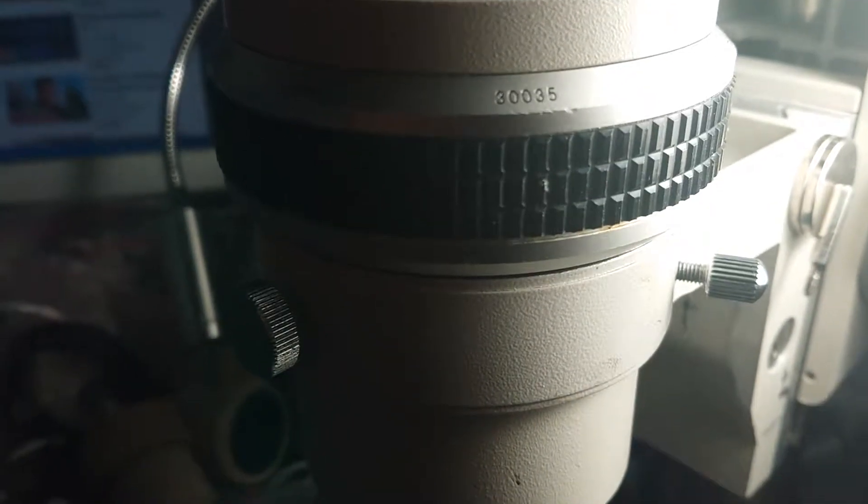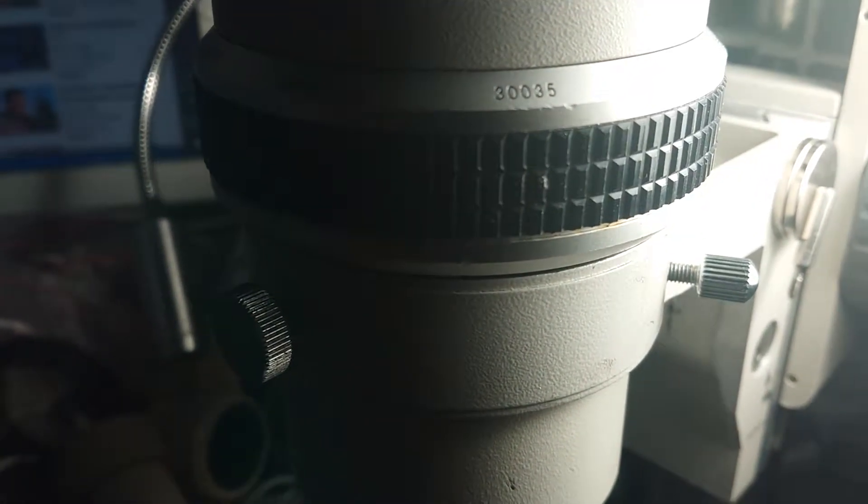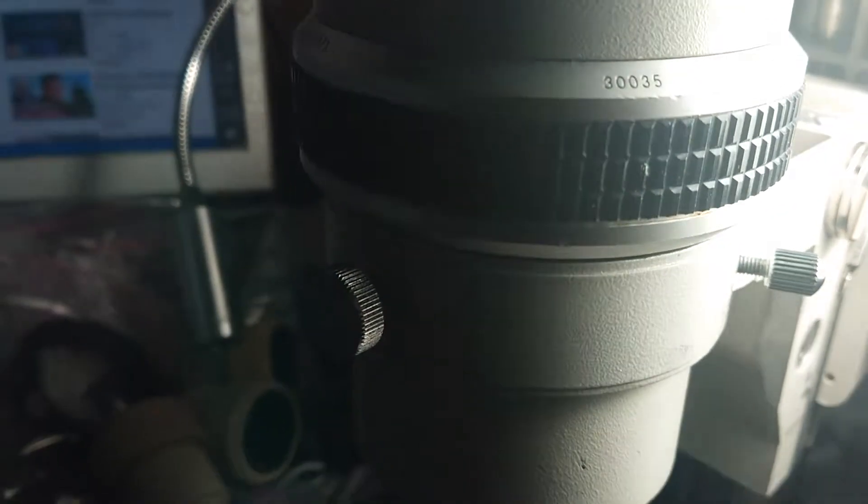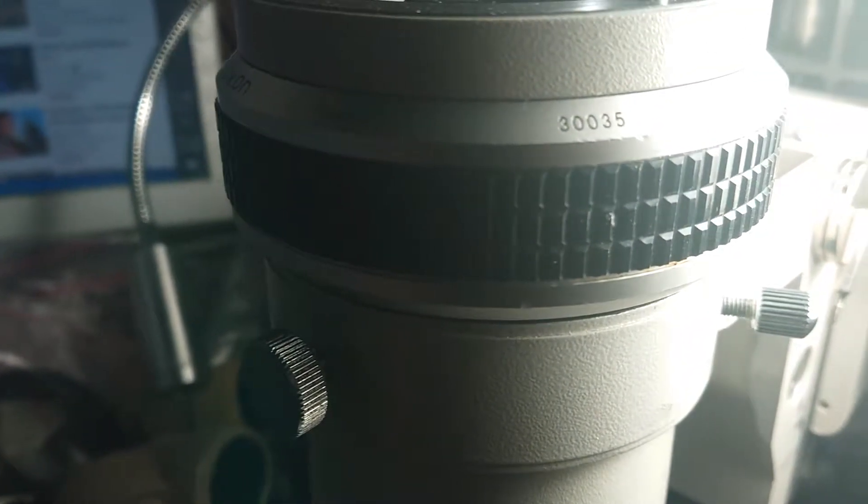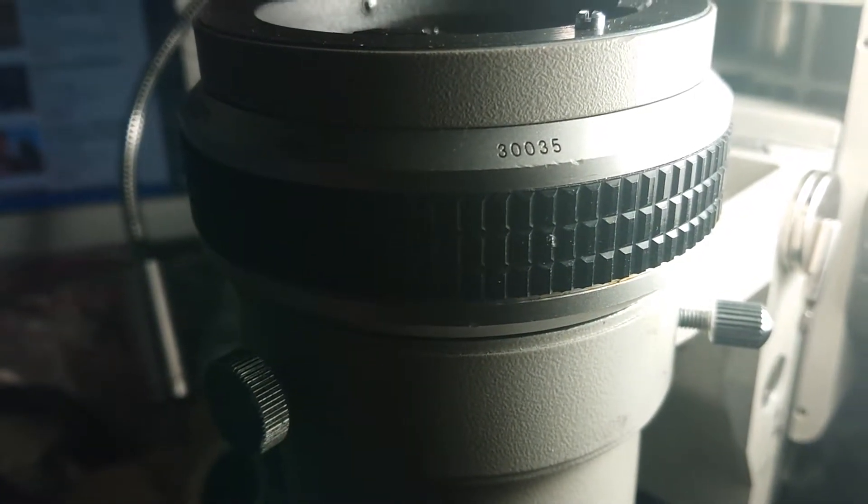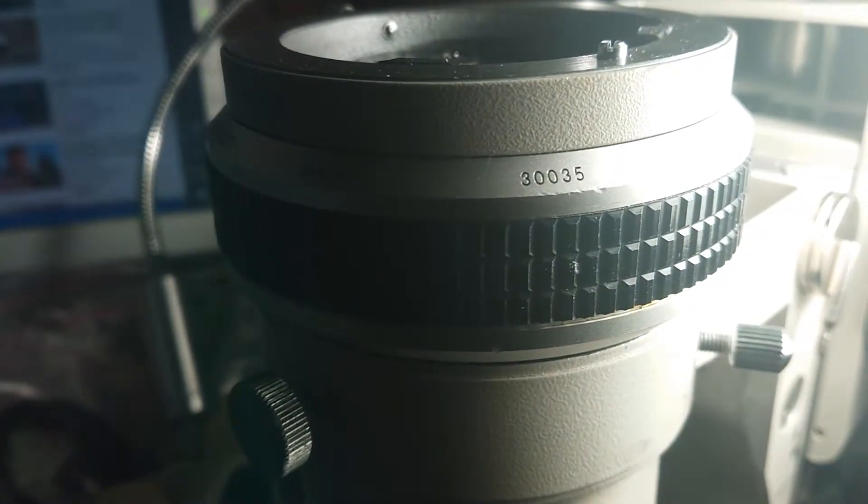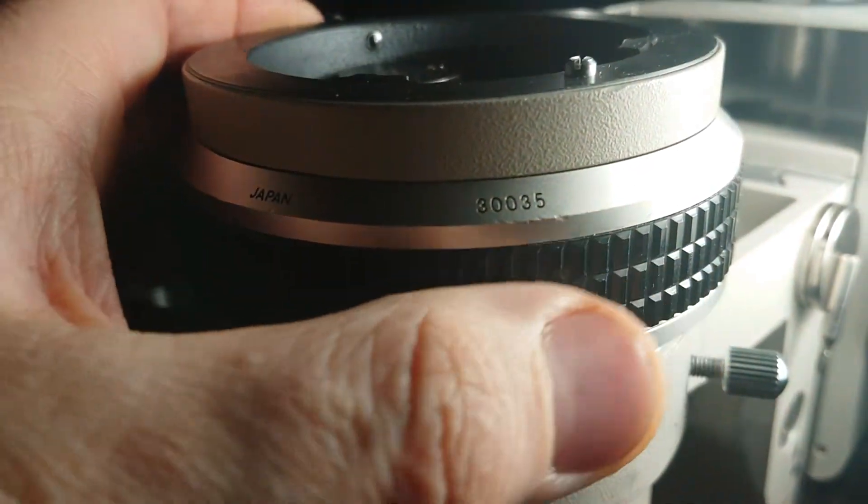Hello again, and now we'll try to make two tests of totally maintained Nikon SMZ 10 zoom modules. So let's see.